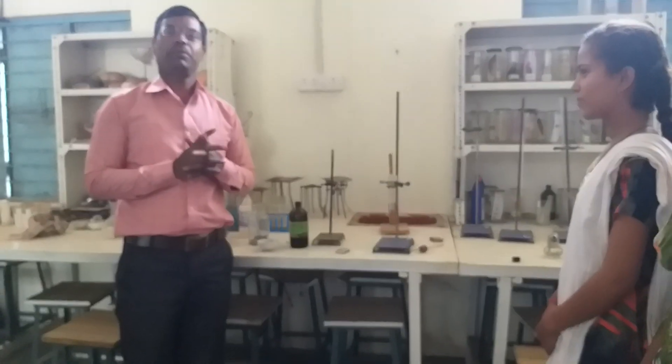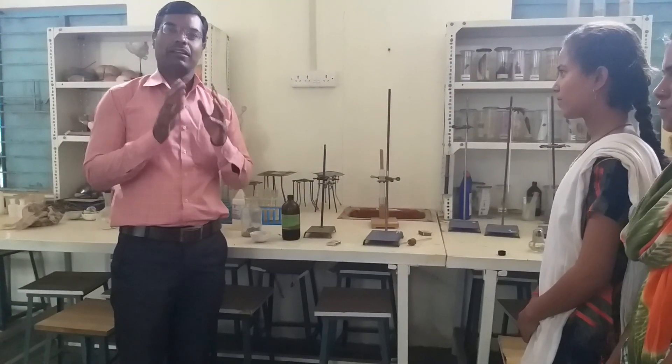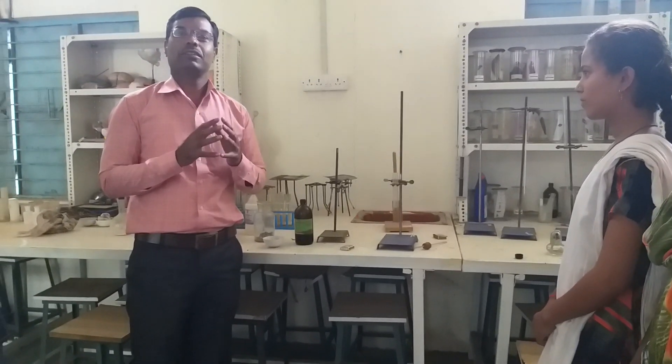Dear students, today we are studying the reaction of metals with acids.